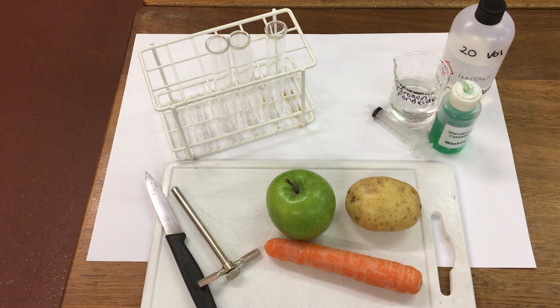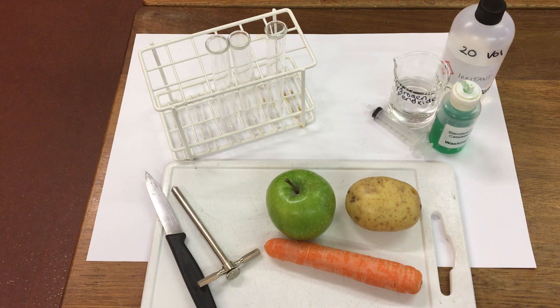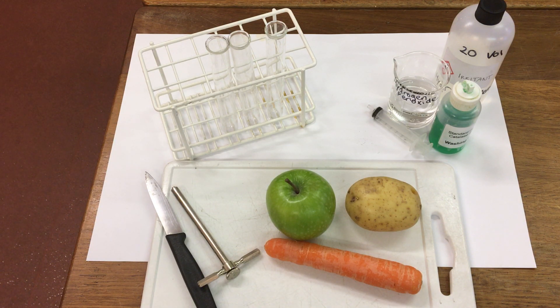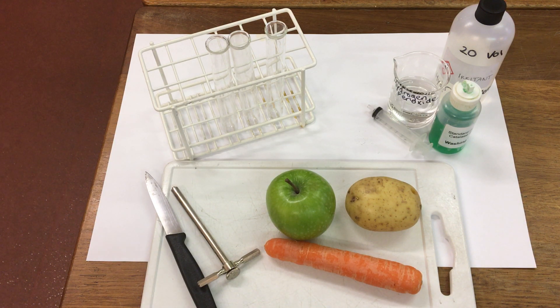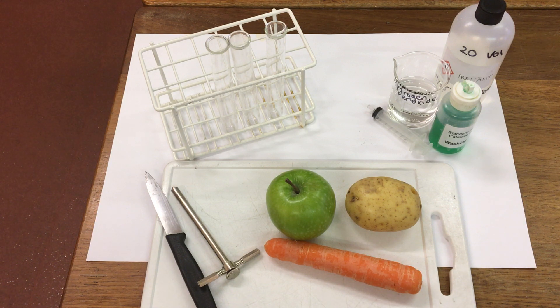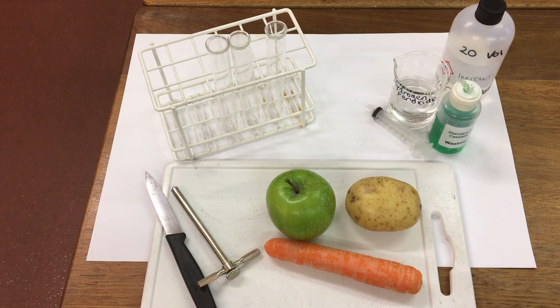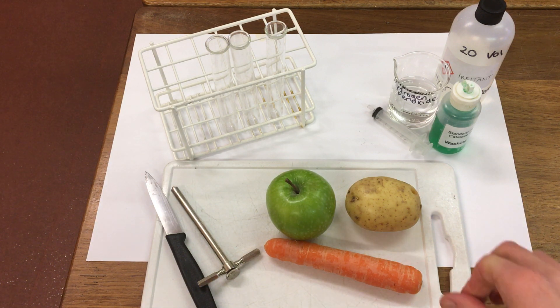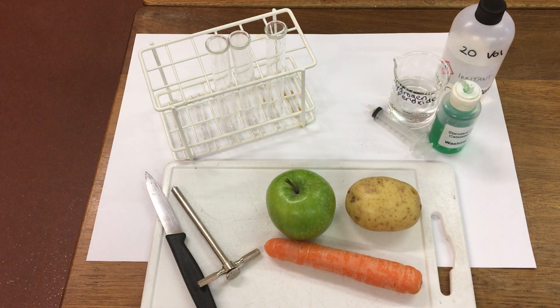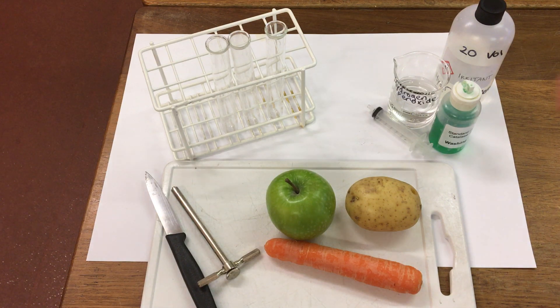A biological catalyst is called an enzyme. The enzyme catalase is present in liver and some different kinds of fruit and veg. We're going to test some different fruit and vegetables today to see what the reaction is.